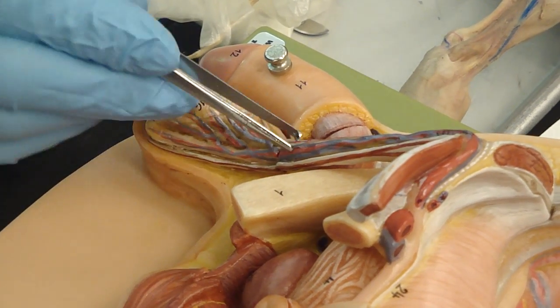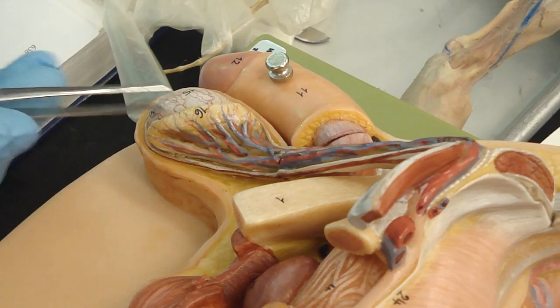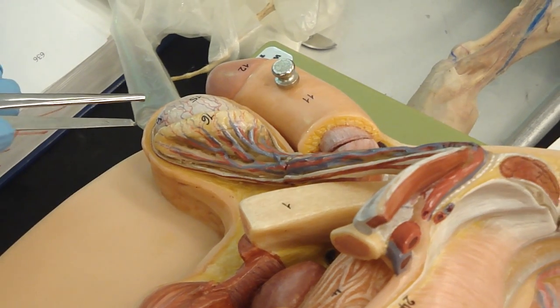Elevate it along with the cremaster muscle to raise it up for temperature regulation. These things are basically involuntary, right? They move it up and down. And when they relax, it goes down and maintains the temperature for spermatogenesis. See?